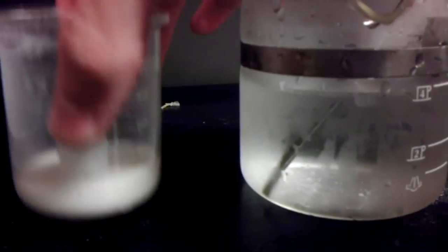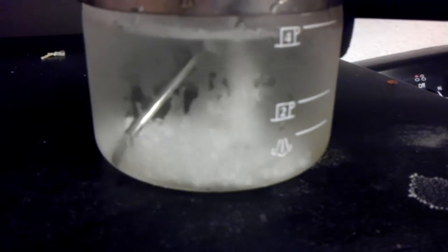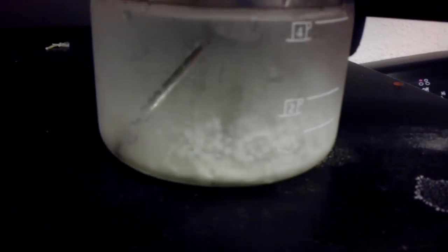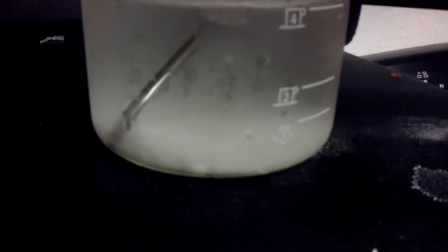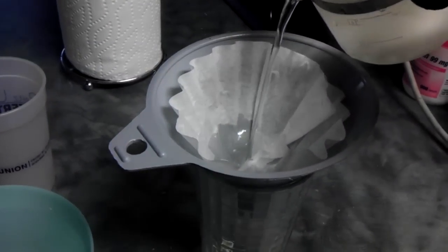Pour your concentrated liquid into cold water. Pour off your solution.